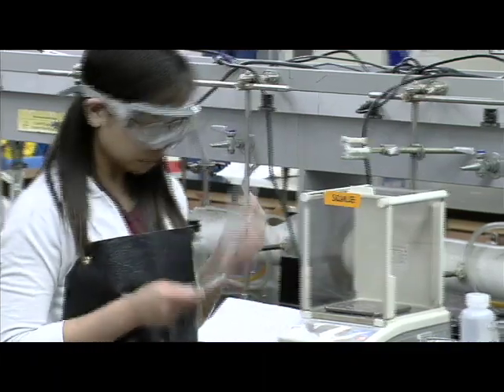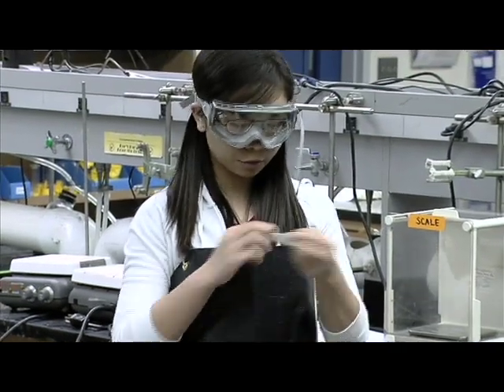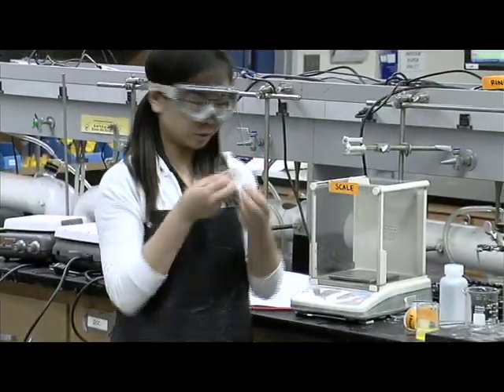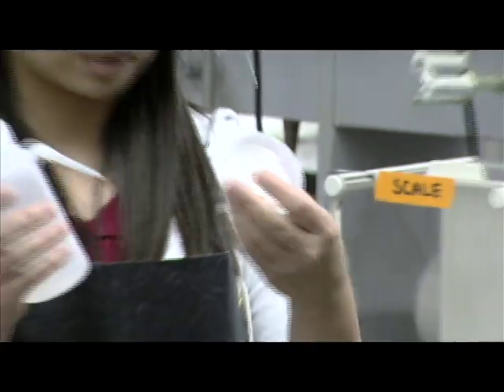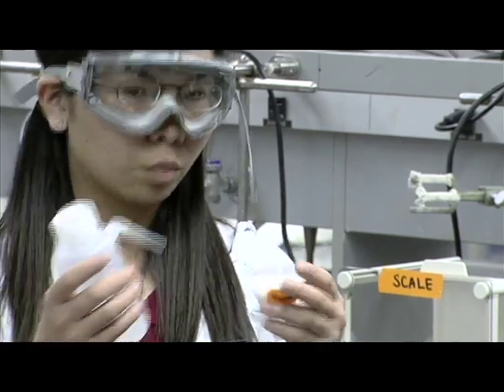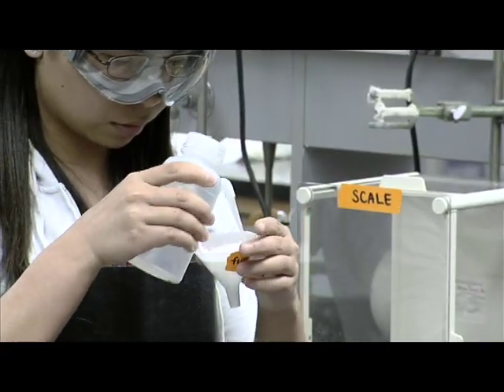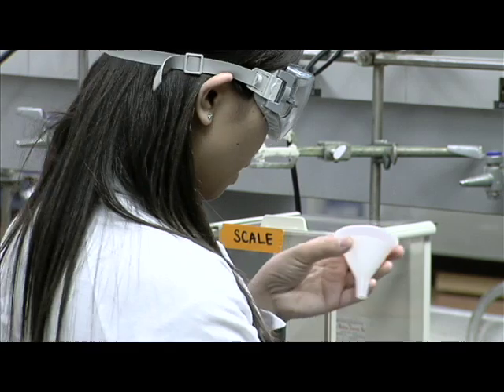After we weigh this, we're going to use the filter paper and fold it in half and into quarters, making it into a cone shape just like this. After we're done, we're going to put it in the funnel. We're going to use the solvent to wet the filter paper so that when you pour the solution into the funnel, the precipitate won't be absorbed into the dry paper. So we're going to wet the filter paper and put it on the ring.